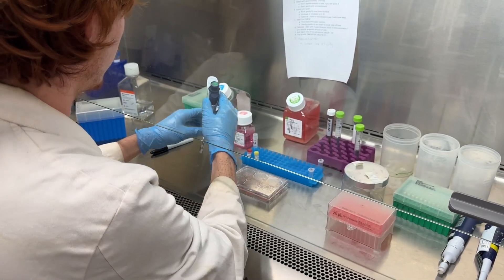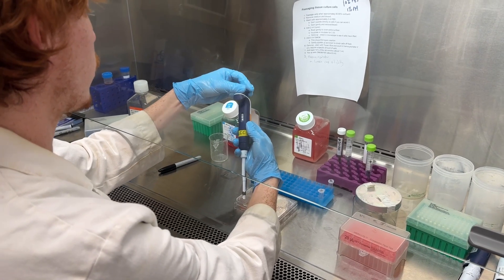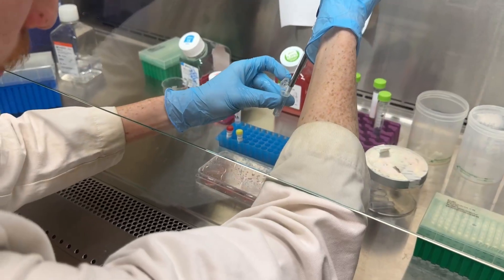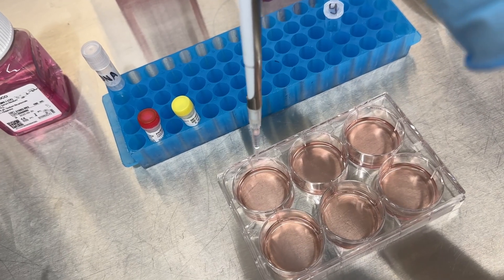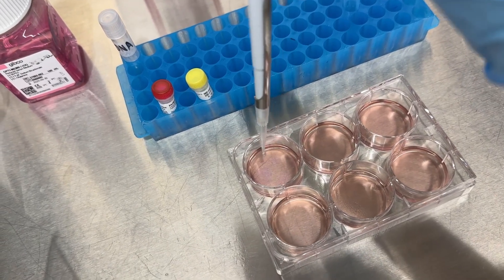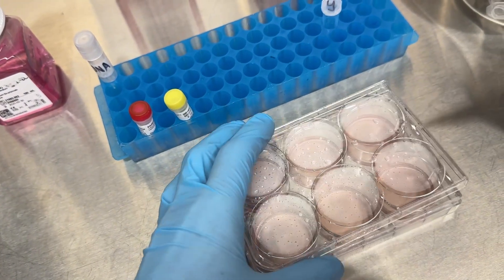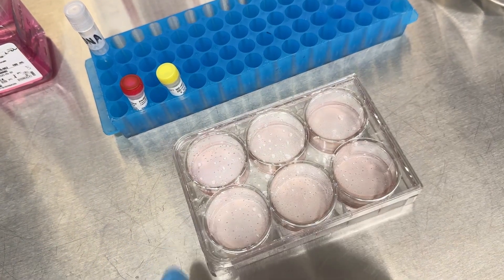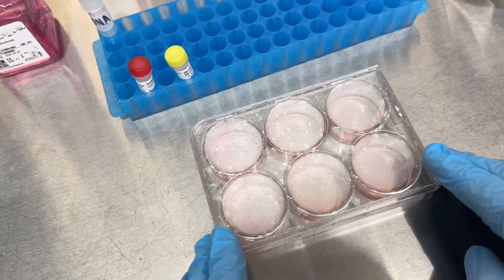It's now been 15 minutes, and at this point we simply add the DNA. You'll see how simple it is — we literally just pipette the DNA into the wells with small drips; don't just gush it all in. Just drip it all over the place. Your DNA is surrounded in little liposomes that will settle in and make their way into the cells.